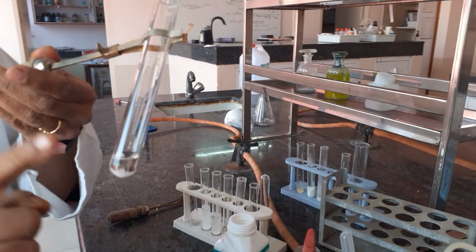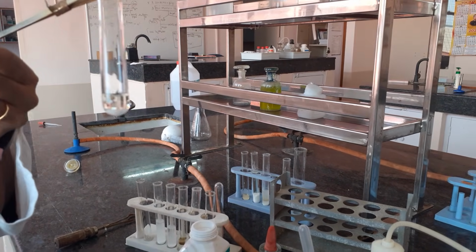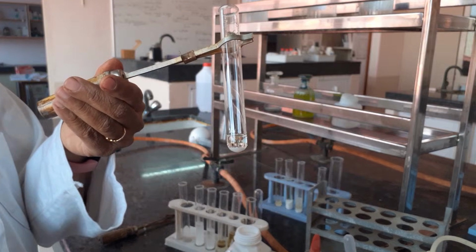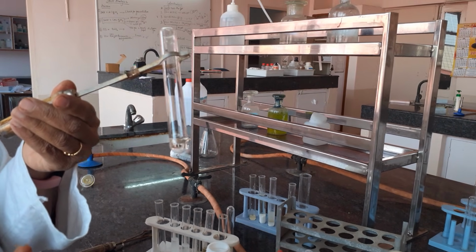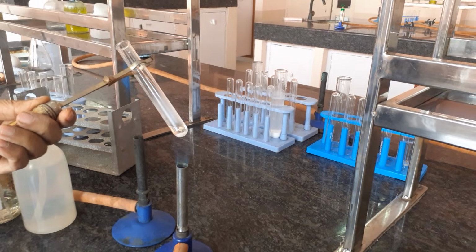This paper piece is acting as the carbon required as the reducing agent in this particular reaction. You can even use copper turnings, but a paper piece can function the same as copper turnings because it has carbon, and carbon is the reducing agent required. You need to heat the contents now and make an observation.